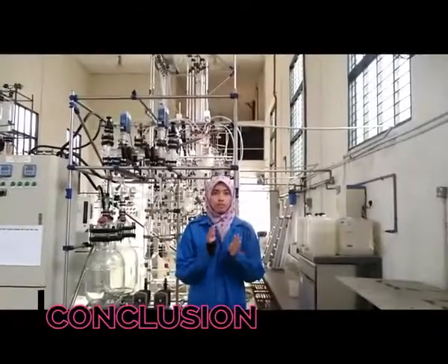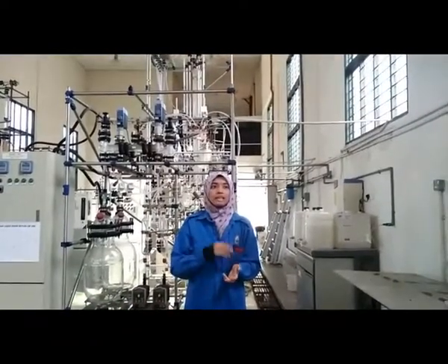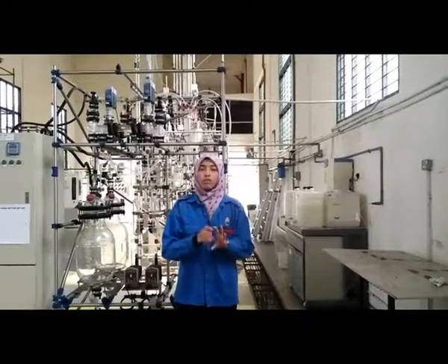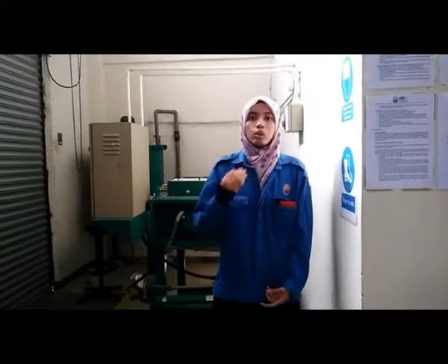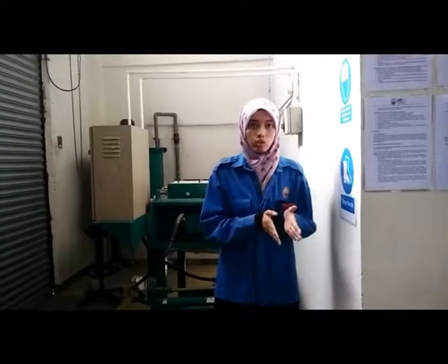As a conclusion for the experiment, all of the objectives were achieved. In order to separate the desired solid constituent or remove any undesirable solute component from the solid phase, which is calcium carbonate, the solid is contacted with a liquid phase, which is water, used in this experiment. So, when two phases, solid and liquid, are in intimate contact and the solute can diffuse from the solid to the liquid phase, which causes separation of the component originating in the solid, that is called solid-liquid extraction.